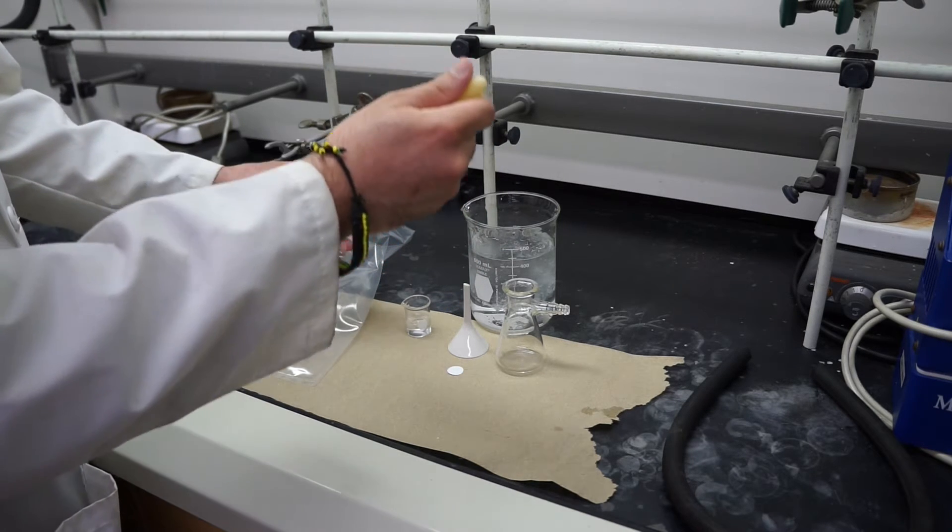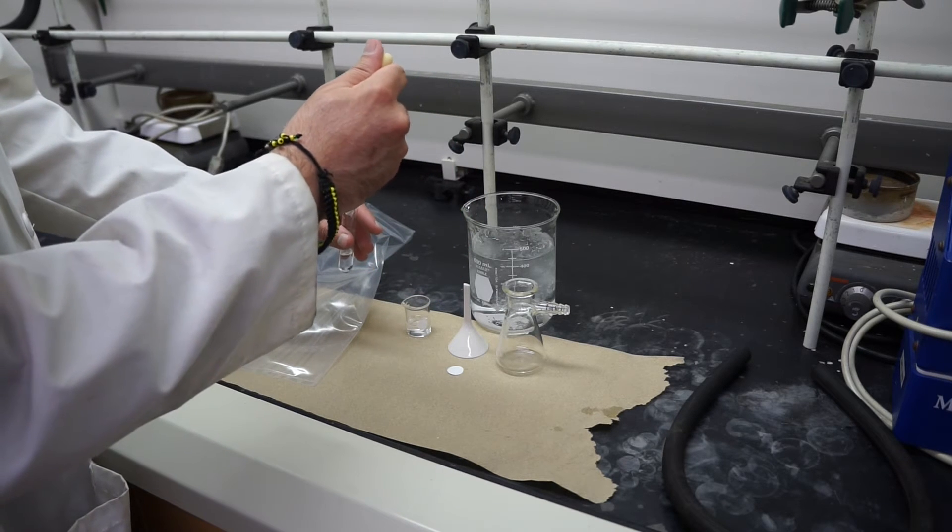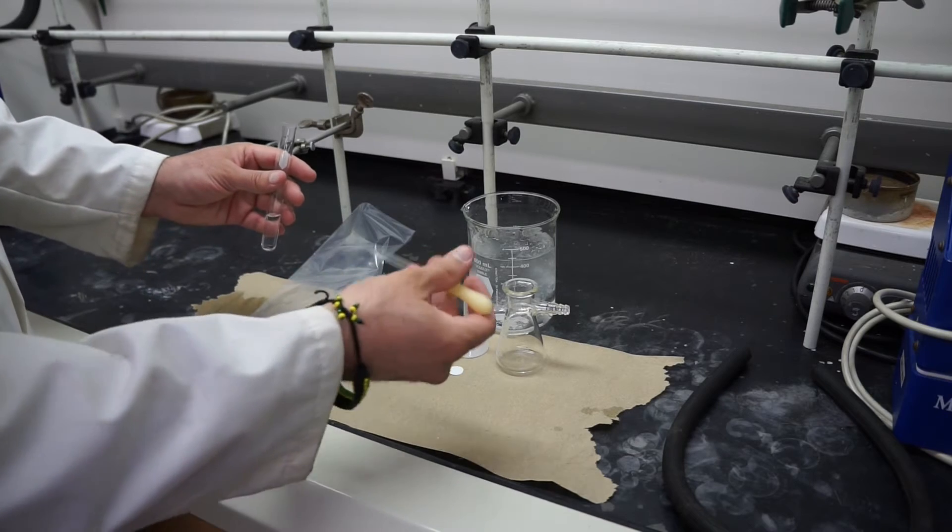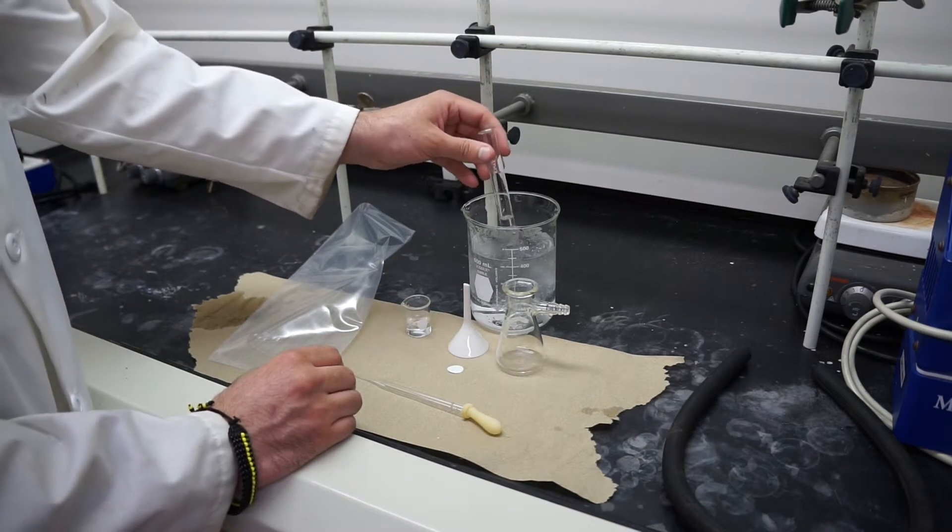I'm going to go ahead and add some in. Make sure I get the sides without really contaminating the pipette. And then we'll go ahead and put it into the ice bath.